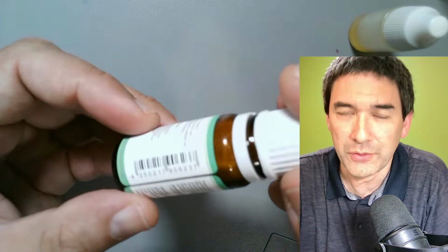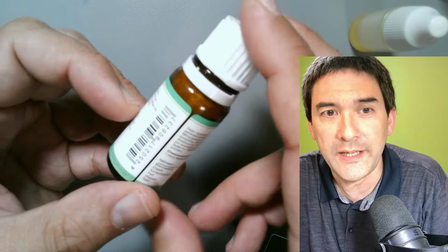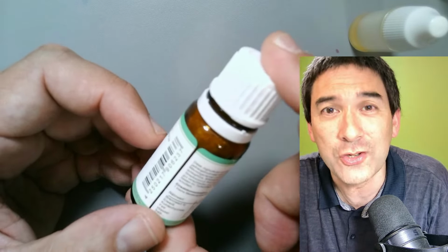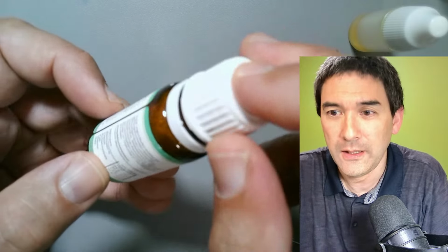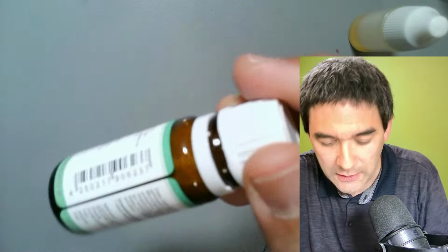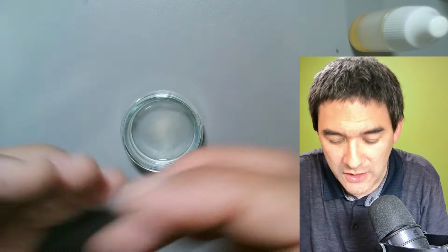And many of them don't die in this process. Some of them might, but there's still a lot that survive, right? So these are freeze-dried. Maybe some of you have also heard of astronaut food that astronauts sometimes eat. It's also freeze-dried. It's completely dehydrated, free of water. This basically means that those bacteria are safe to eat. And what I've done is I've taken a little sample a few hours ago, and I've added it to a little bit of water and allowed it to suspend a little bit, so that the clusters break apart.